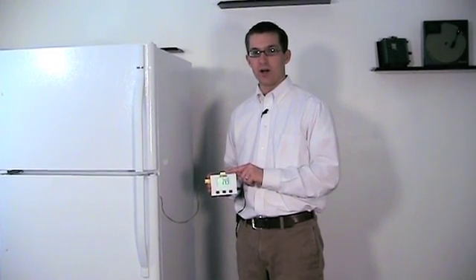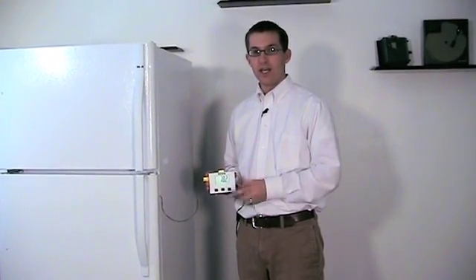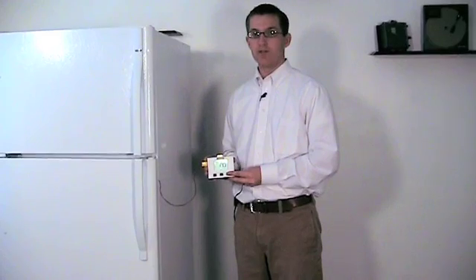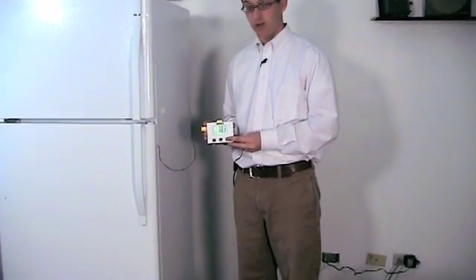After inserting the memory card in the top of the logger, hit the save button to transfer the data from the unit to the card.